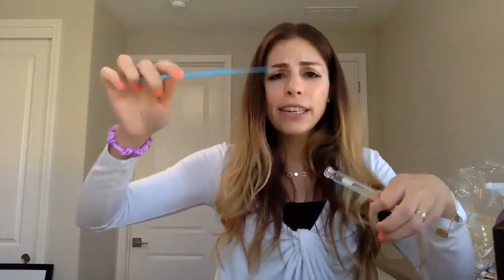Now, this is where students sometimes get confused. So I see a lot of bacteria on my slant. You need the tiniest amount possible. Don't go like that and scrape off a lot of bacteria. If you can see bacteria on your loop, then you took too much. If you did make that mistake, it's okay, but just for the future, you need very little. You don't need to go like that and take a lot. So I'm going to go inside my slant and just pick up a little bit of bacteria, which I did here.